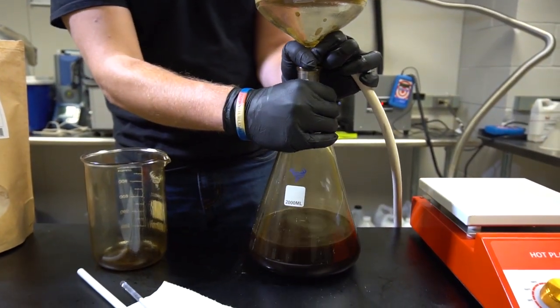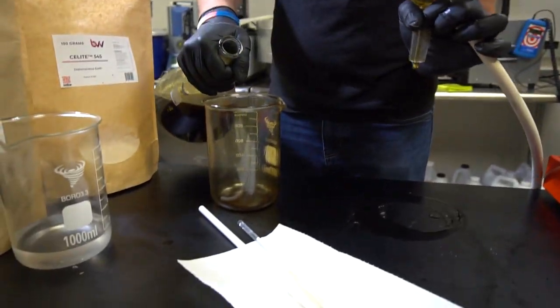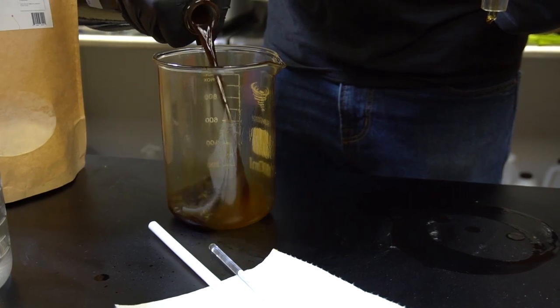After my first pass I'm going to take it out, put it back in the beaker, and then I'm going to add some activated charcoal straight to the solution here.